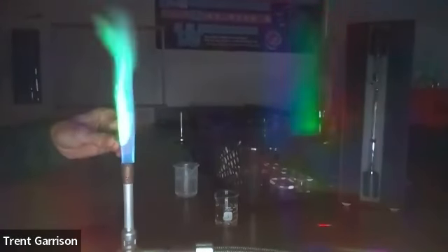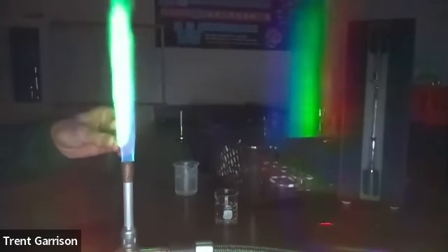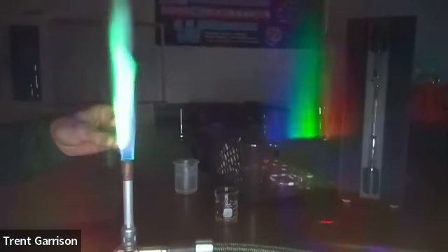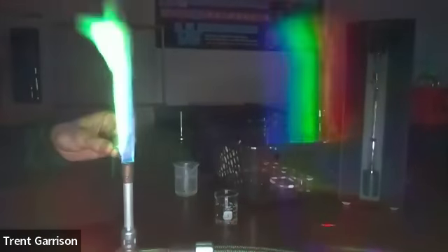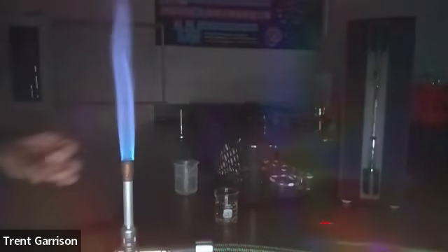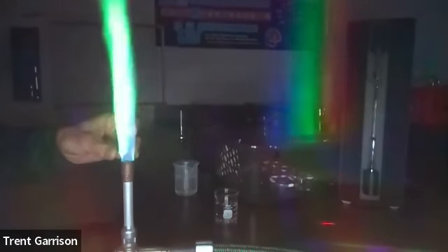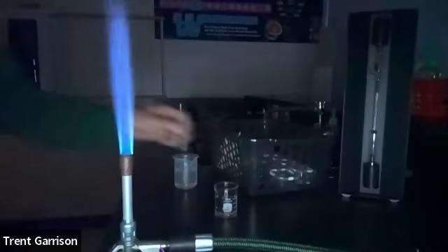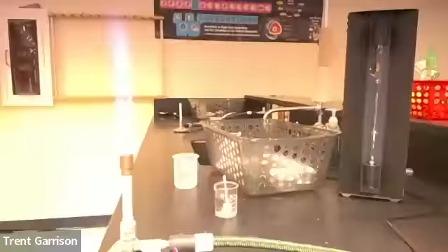And you notice it's made up of those 3 colors over there. It's got some blues. It's got mostly green. It has a little bit of red off to the side. Again, this would allow us to identify the elements, not based necessarily on the color, but what proportions, parts they are made up of. Okay, this is everything that I wish to share with you today about the flame test.